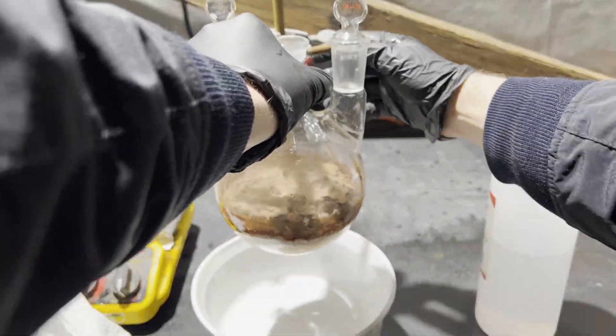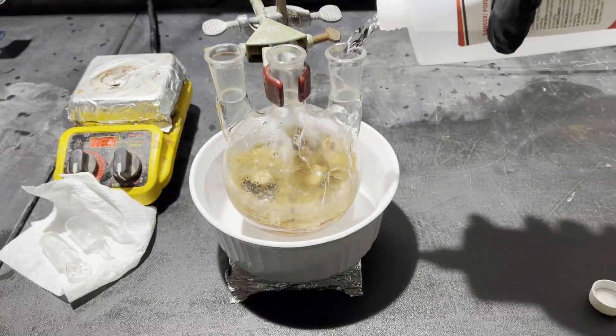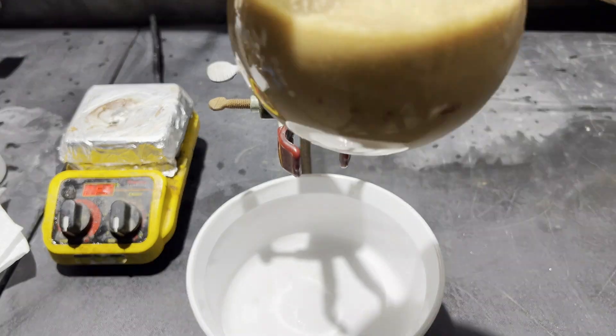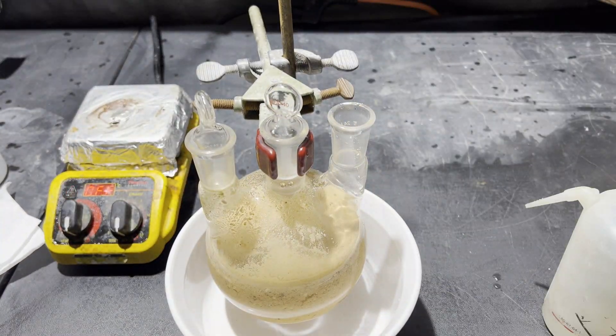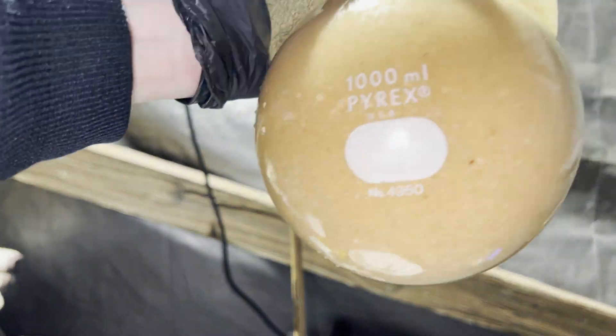But now I'm about to destroy it. The next step is to add 666.666666 milliliters of 1 molar sulfuric acid to it and stir vigorously for at least 3 or 4 hours, but they kinda recommend overnight, which is what I did. And I switched the stir bar.